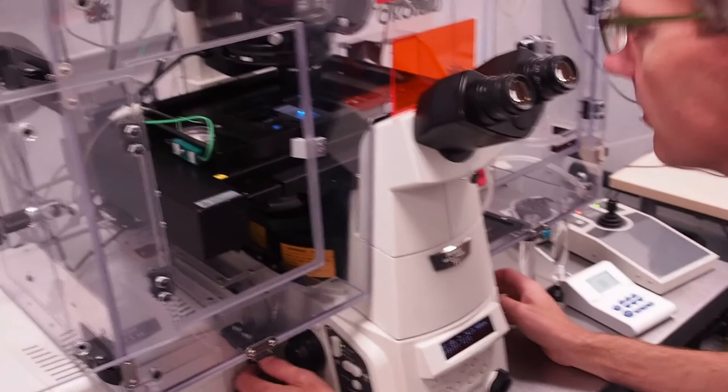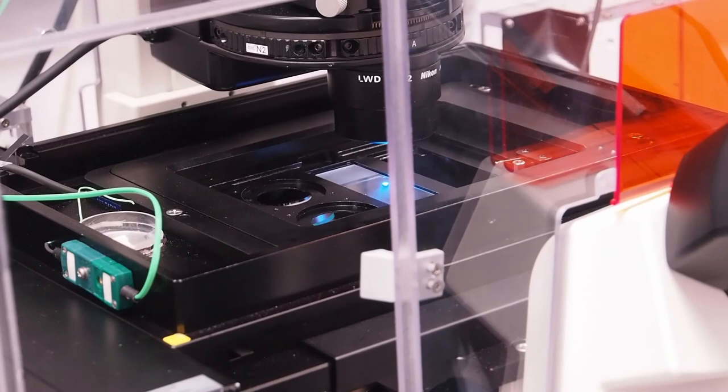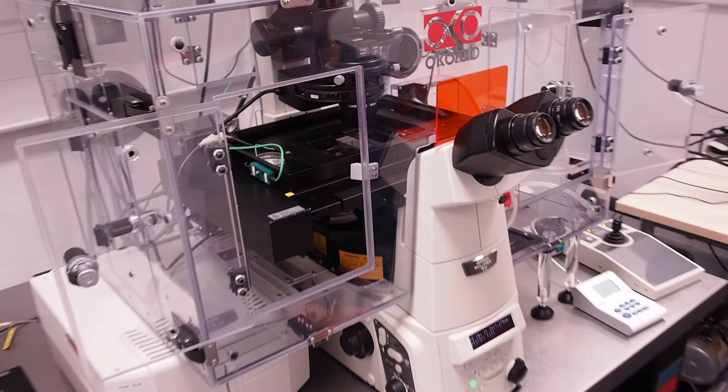If you're unsure you can use all three. The excitation filter in the selected cube will block the other wavelengths. Fine-tune your focus and position and once satisfied switch the fluorescence lamp off to preserve your sample.